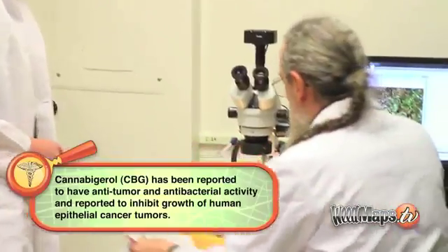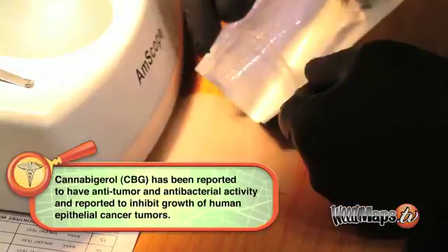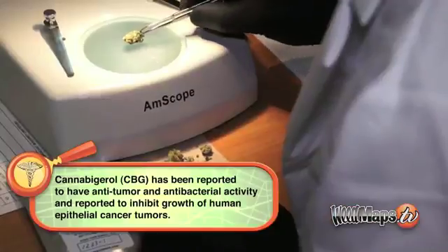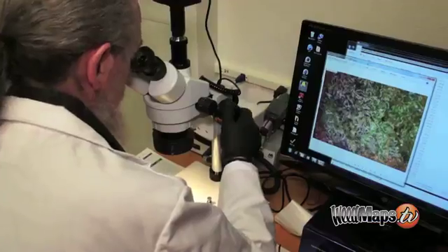From the very point we pick it up to the last time when we send out a report, they would bring it back to me. I would check those numbers to make sure that everything is correct. After that, I would start a microscopic procedure and visual inspection, and look for infestations of mold or fungus and things like that.